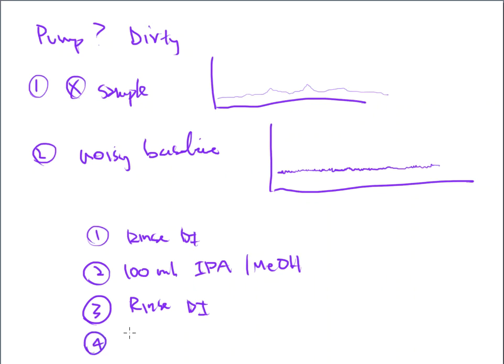And finally, number four, what they would really like for you to do, if you can remember it, is that you then rinse all of the pieces with the eluent that you are using on the machine. So if this is an anion setup that has a bicarbonate-carbonate mobile phase, what they would like for you to do is to take some of that mobile phase and rinse off all of these pieces with it, so that way it can be primed and prepped for the mobile phase that will begin to come through. You're not contaminating the mobile phase that's currently in your lines with DI water or isopropyl alcohol or methanol as it makes its way through the system.